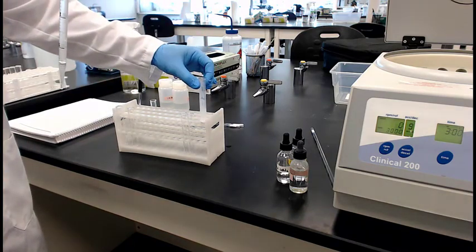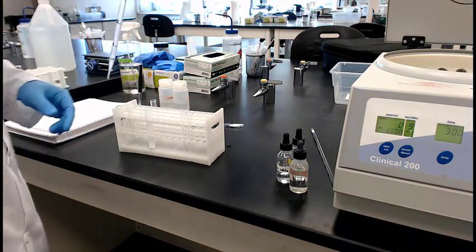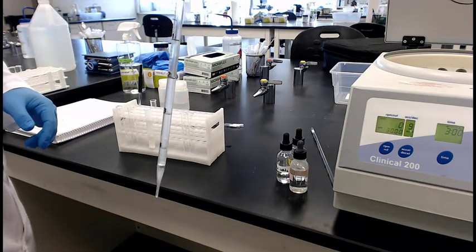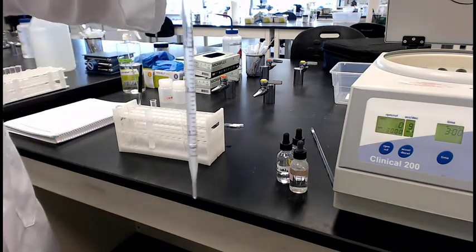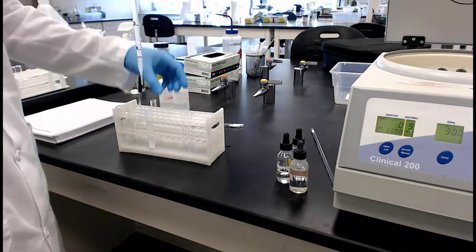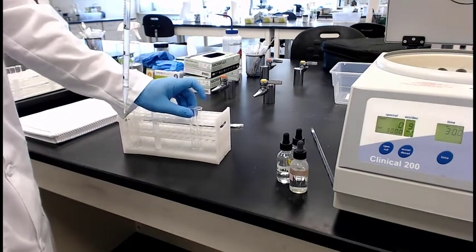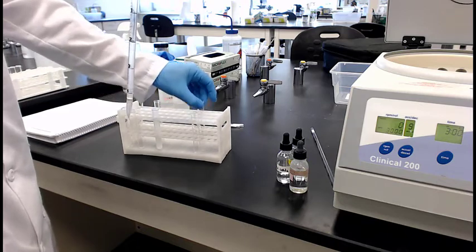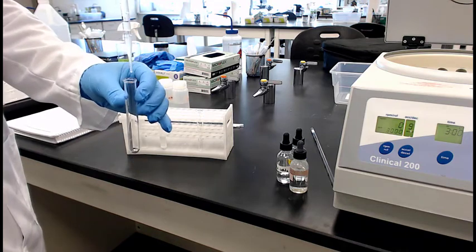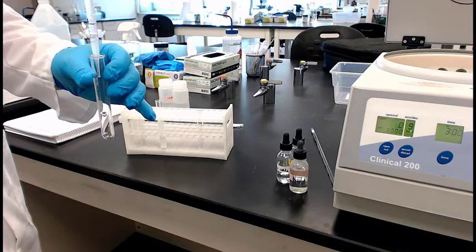Cool. So that's fairly clear he has there. And he's going to set it into, it's a little bit cloudy, but it's mostly clear. And he's going to put it into 2 different tubes. Got his tube stuck. He's doing that waiter style. Okay, that's good. Yeah, put your tip in there.